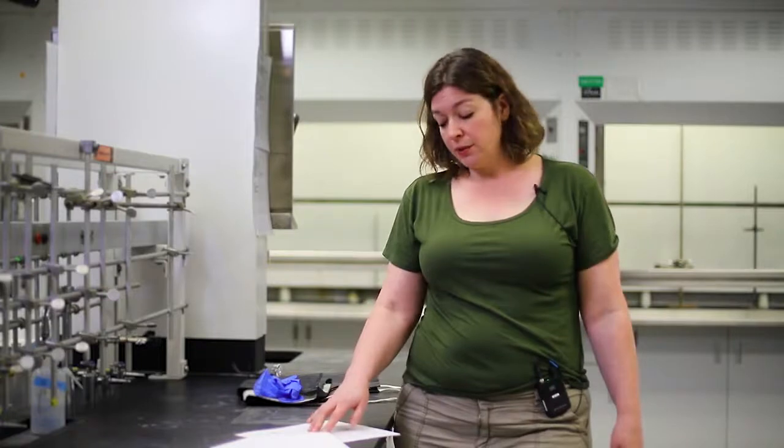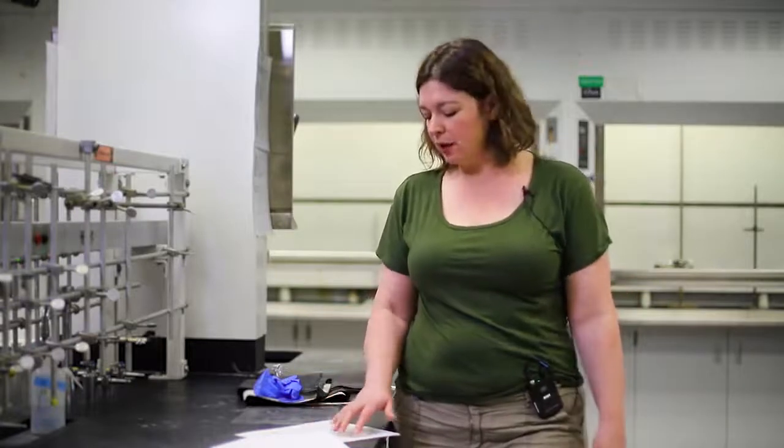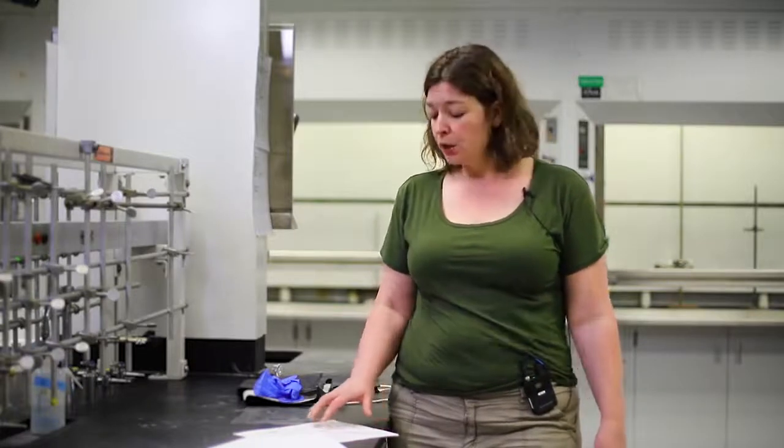Things that are health hazards are things that pose a potential hazard to your health, obviously. You may have a single exposure that could be a hazard, or it may take repeated doses to cause a hazard. These range from minor irritants, which can cause just a burn or abrasion on your skin, to things that are toxic, or sensitizers or carcinogens. Again, you're not going to see much of this throughout the course of general chemistry, but we want you to be aware that this could be a concern in science lab.